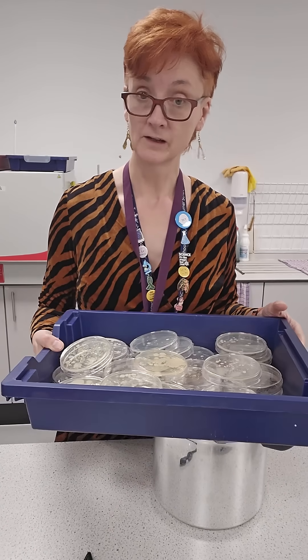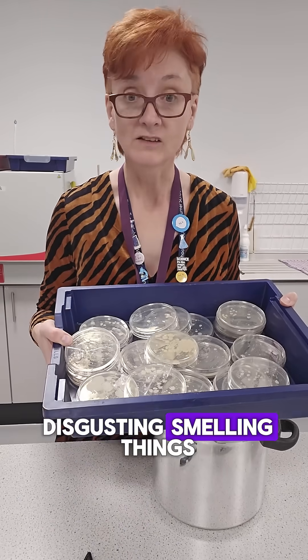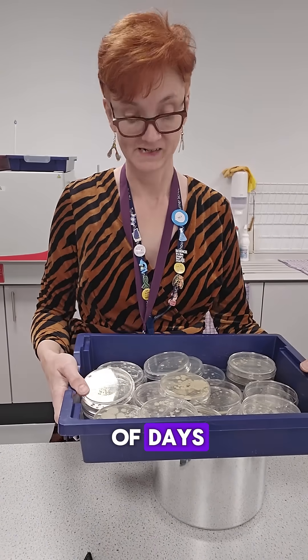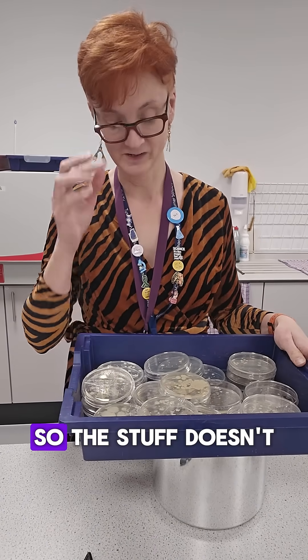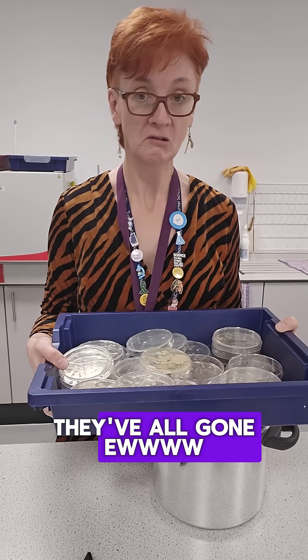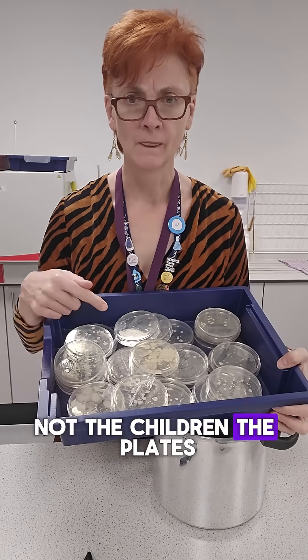Not least because I mostly live here. So now, what do we do with these once we've got these disgusting smelling things? We wait for them to grow — basically we incubate them for a couple of days so stuff grows, then we turn the incubator off so things don't get out of hand. Anyway, we've just shown the kids, they've all gone, and now I'm going to murder them all — not the children, the plates.